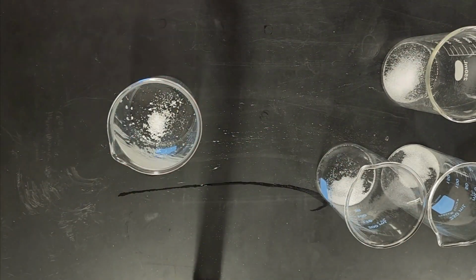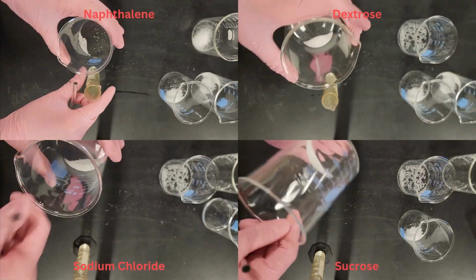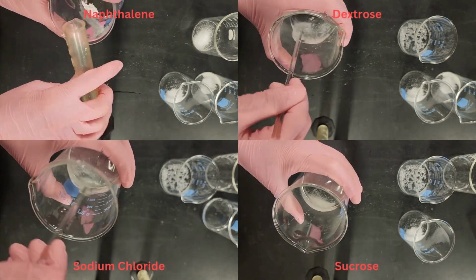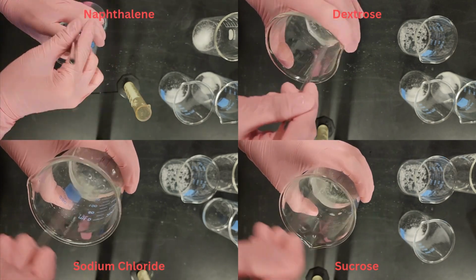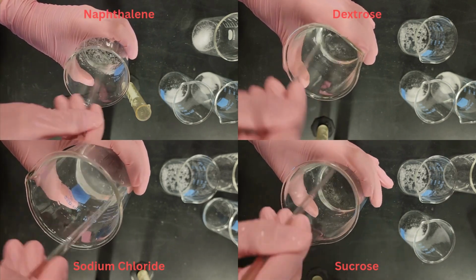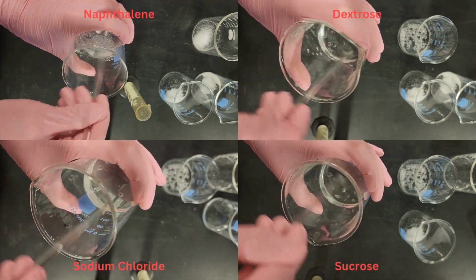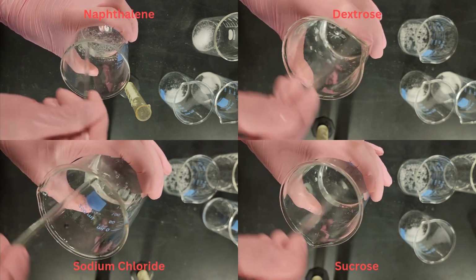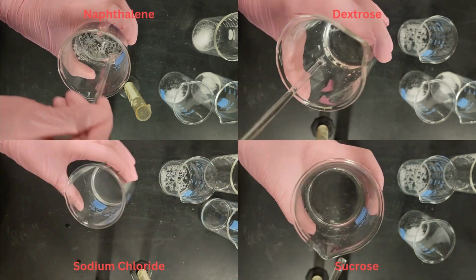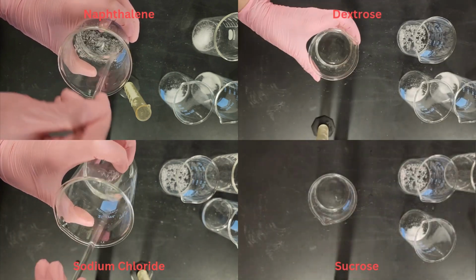In order to test the solubility of each of the chemicals, I used a 250 milliliter beaker and put in 1 gram of the chemical. Additionally, I used 10 milliliters of room temperature distilled water. I then poured the water into the beaker with the chemical. I began quickly stirring with the stirring rod and seeing how long it took for the chemical to fully dissolve, and after about 2 minutes had passed, if the chemical didn't dissolve, I chose to stop stirring at that point. This process was repeated once for each of the chemicals.